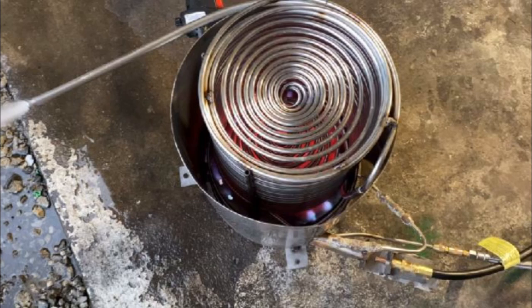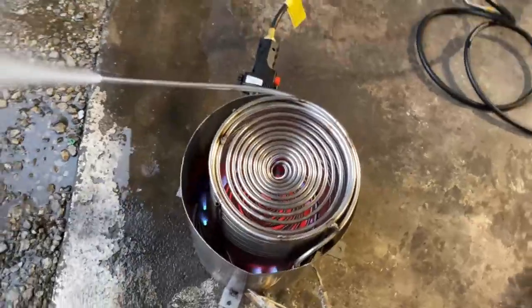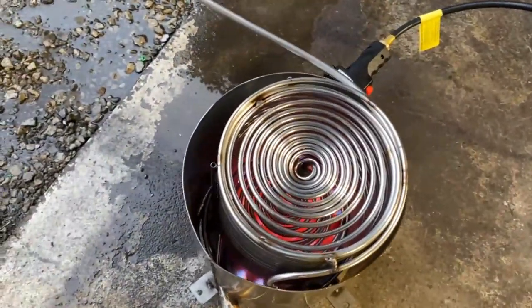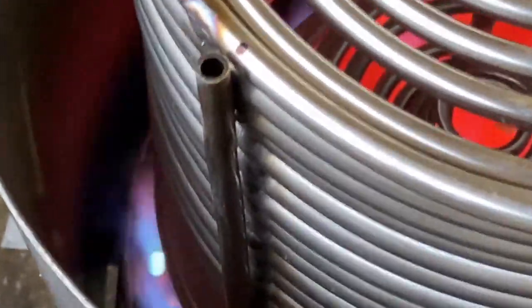If you find out you need more power out of this boiler, there are some things we can do. We can take a small electric blower and add air to that intake and increase the propane input, and it won't be so loud.